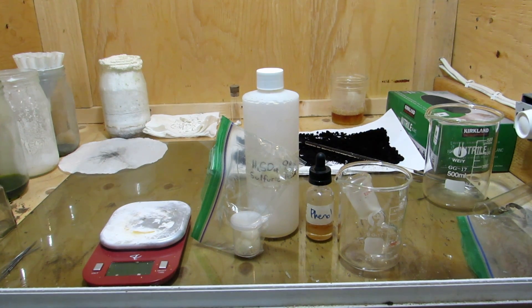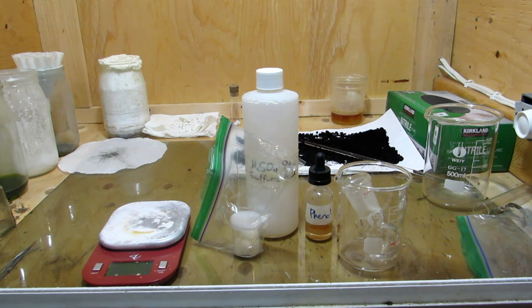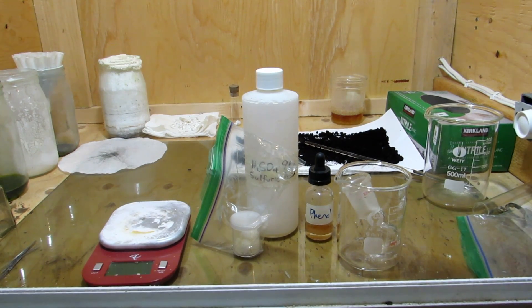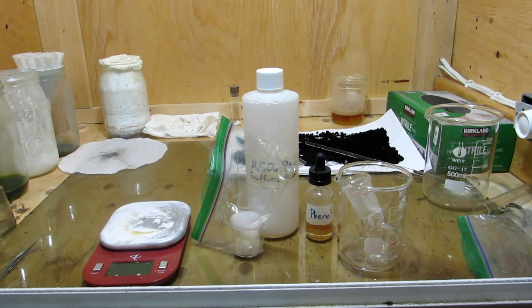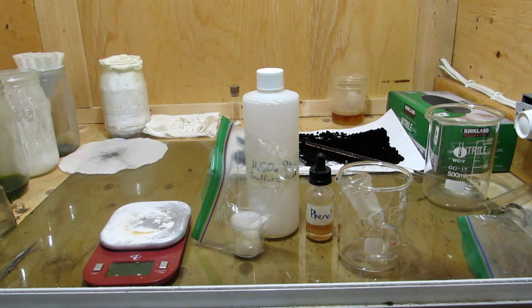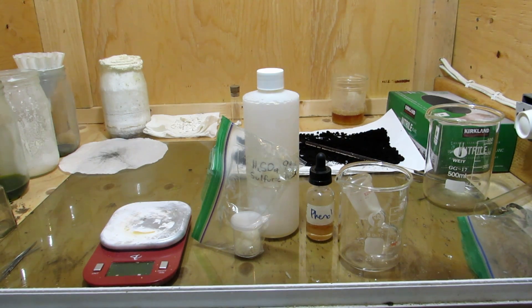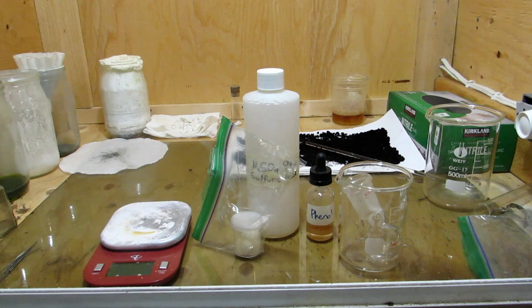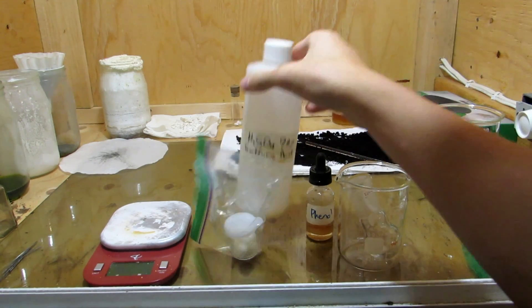Hey guys, welcome back to another video. Today we're going to be making a compound called phenolphthalein, which is a common pH indicator. I've been waiting to make this phenolphthalein forever, trying to get all the materials from household materials, and we finally have it.